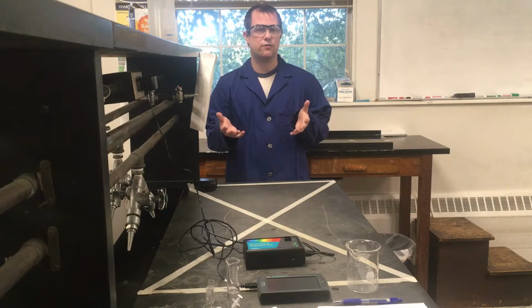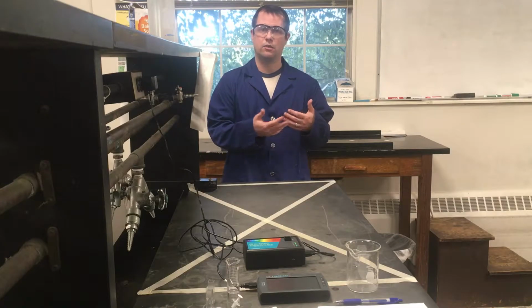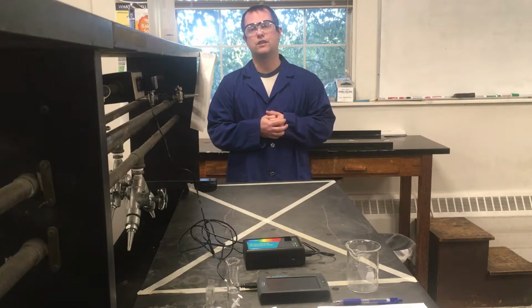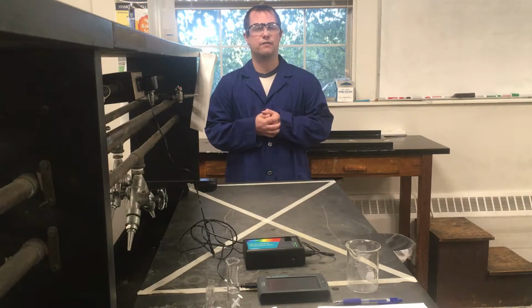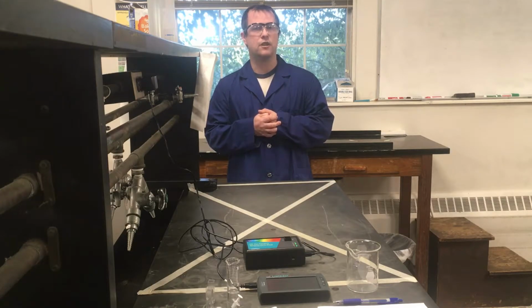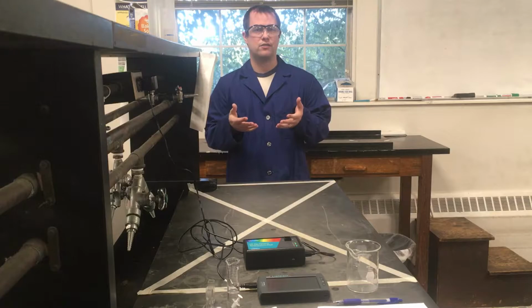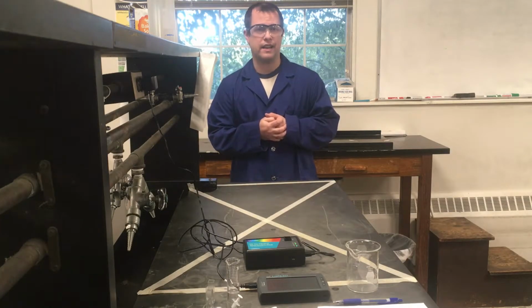Beer's Law deals with the fact that the absorbance of a solution is directly, or linearly, related to its concentration. We take advantage of that fact to figure out unknown concentrations, which is the usual goal. Although in this experiment, we're going to do something a little bit different, which will help us figure out some kinetics information for the next lab, lab 5, which will take a look at kinetics as well.